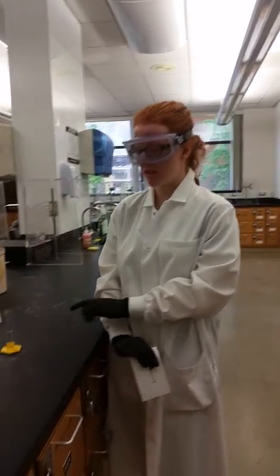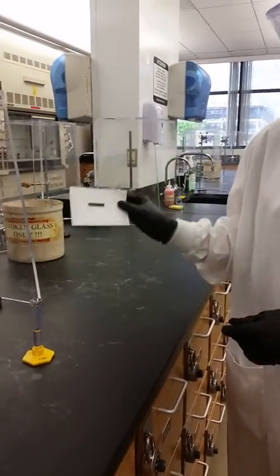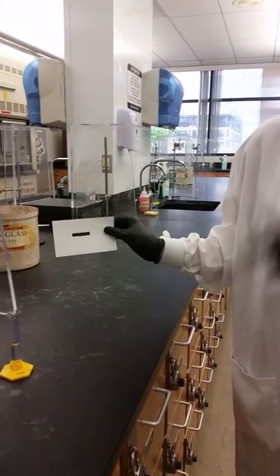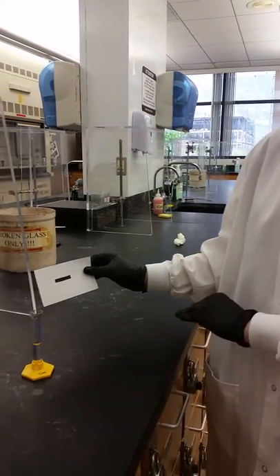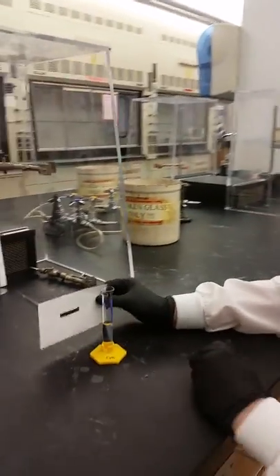I have my graduated cylinder here and it has a volume, and I'm just going to measure it. I am going to use a black object to go behind it to make the bottom of the meniscus more visible. But I need to go down to eye level.